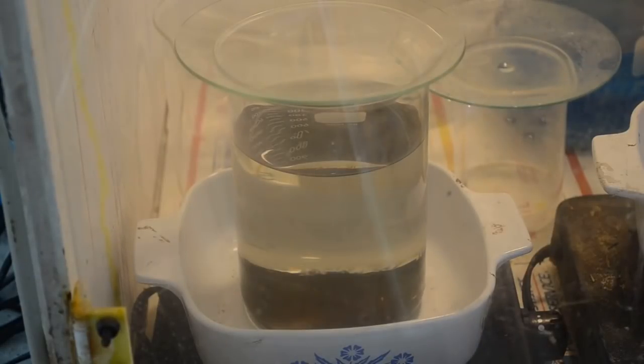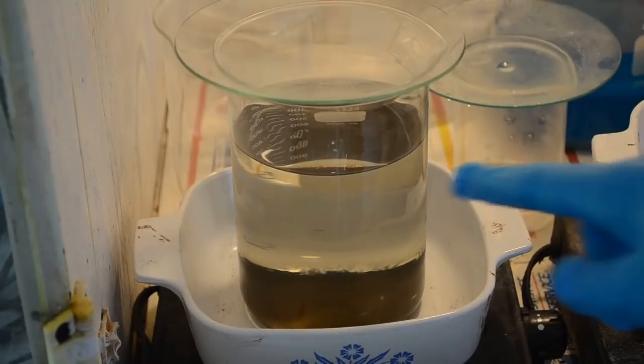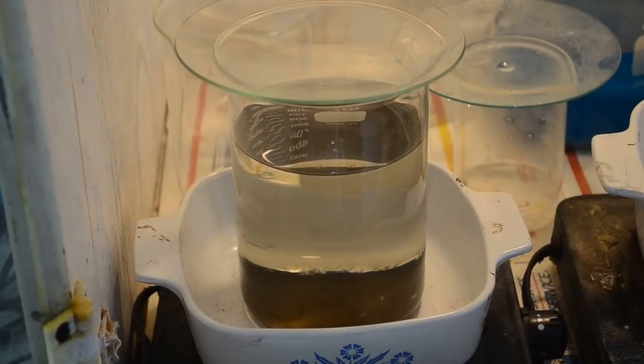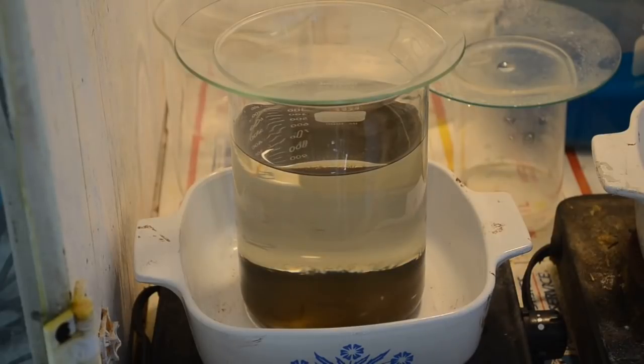Well, good morning. It's the next morning and look what we have here. Wow. Look at that. That is some nice clear liquid. Looks like we had a nice clean gold drop out of it. No more of the lime green Kool-Aid crap. It looks like there's a nice thick layer of gold on the bottom of the beaker. Of course, it always looks thick when it's wet on the bottom of the beaker. We'll see how much gold's really there.